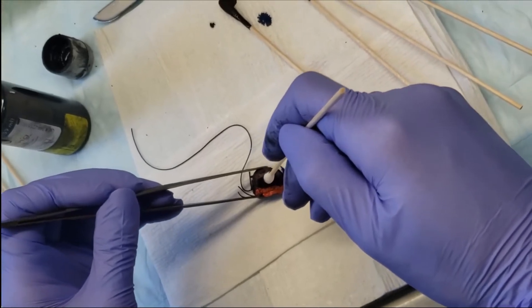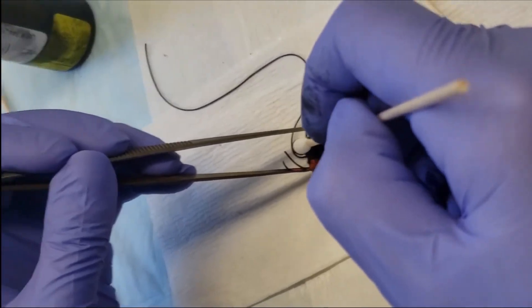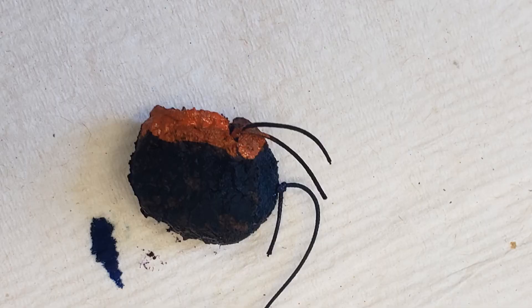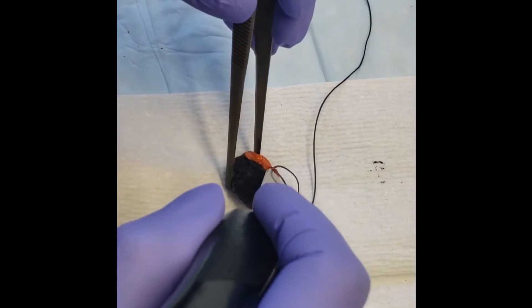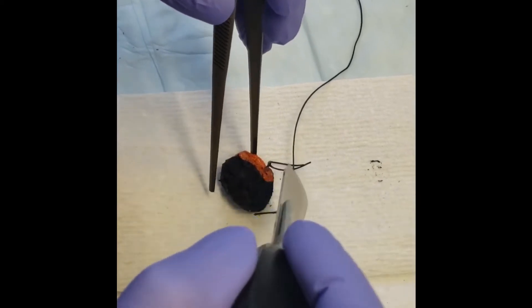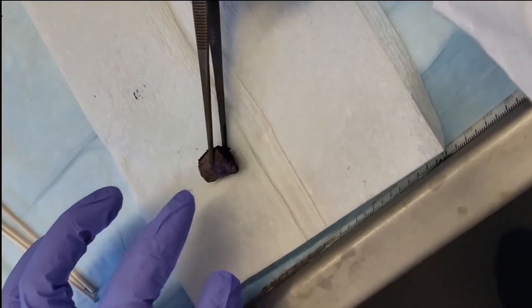It's really important to clean the forceps between each color — you don't want the colors to bleed — so we do this very carefully and precisely, especially in a small specimen like this. We don't want to make a mess with our ink so we blot it to dry it. This is the final result. Once it's labeled we don't need the sutures anymore, so we remove them by cutting at the knot, being careful not to cut the specimen. Then we use a setting spray to make sure the ink stays on the specimen.